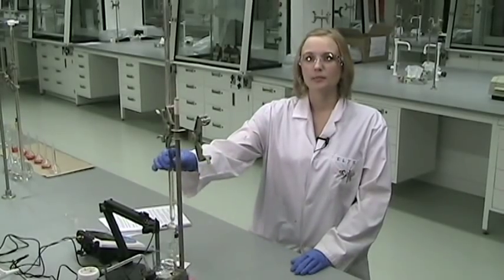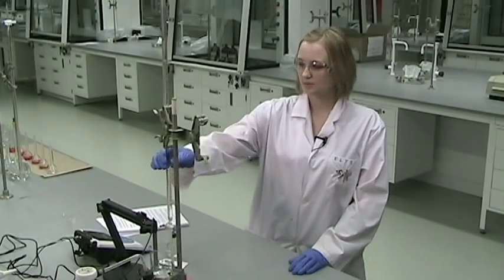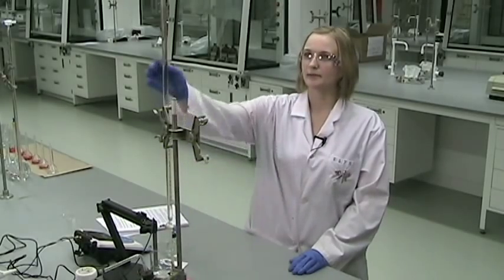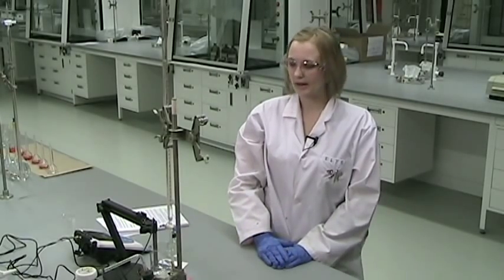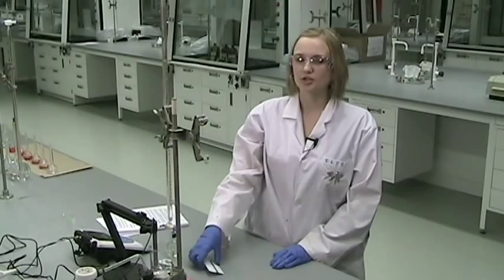I have filled the burette with 0.1 molar NaOH, and you notice I haven't bothered filling it right to the top to the zero point. It doesn't matter how much you fill it up as long as you can take a reading.